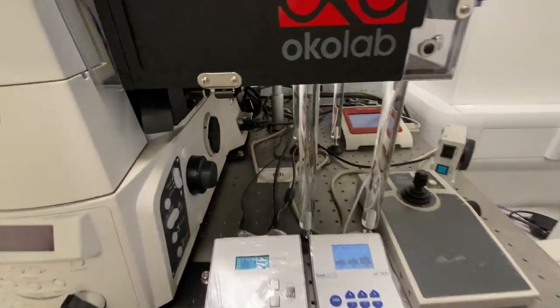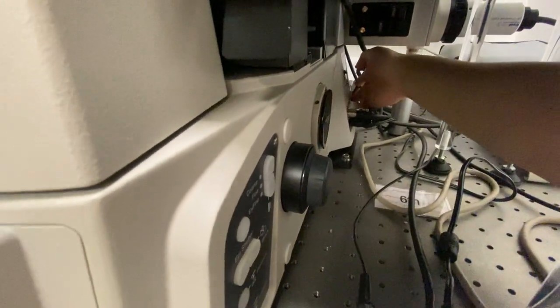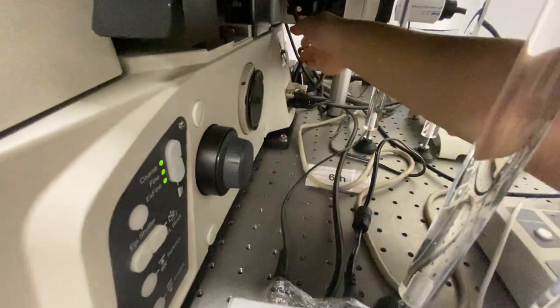So after you've checked the last person hasn't left anything in, you can switch on the main body of the microscope.